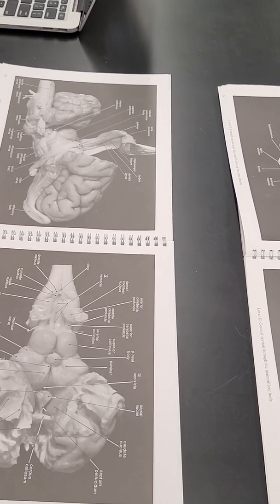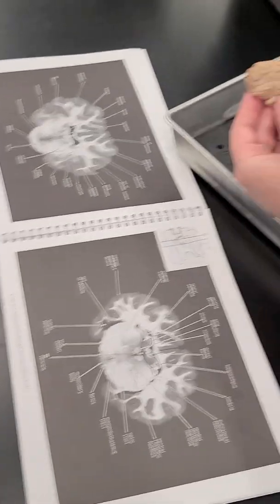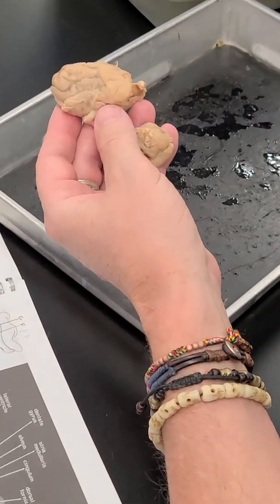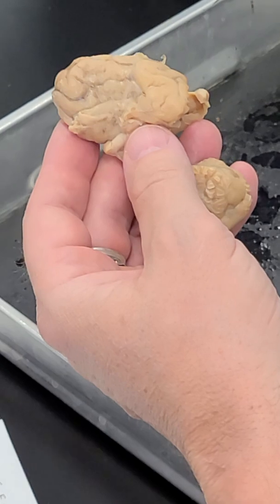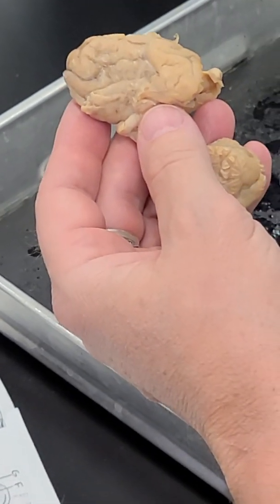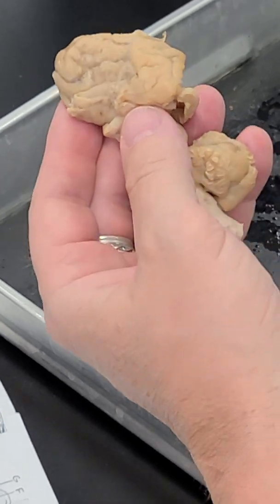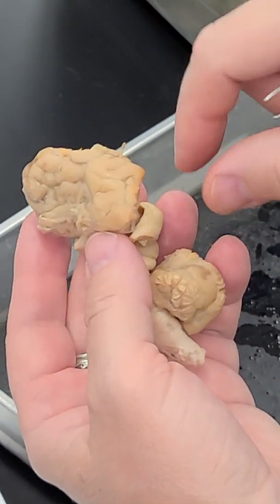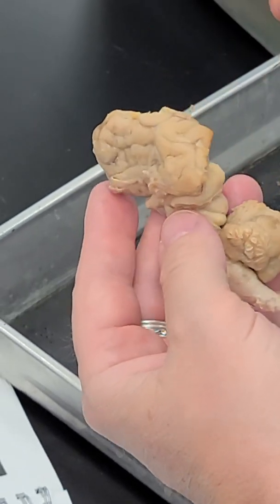Do we need to know? Sorry, what was subiculum? Subiculum is the tissue right next to the hippocampus, and it's one of the important areas. It's a continuation of the hippocampus, but it's not enclosed within the original hippocampus as it's been described.